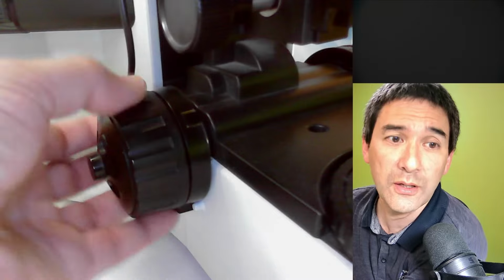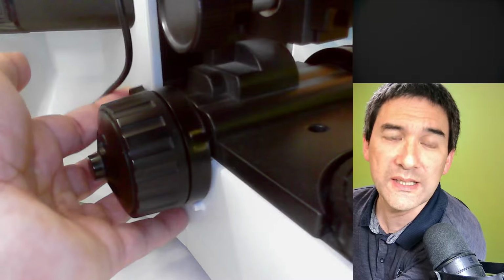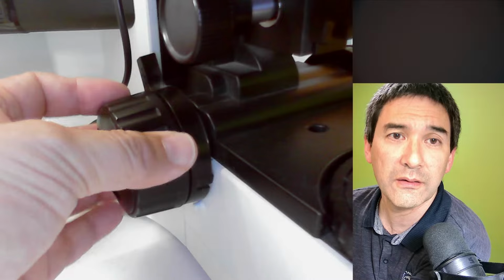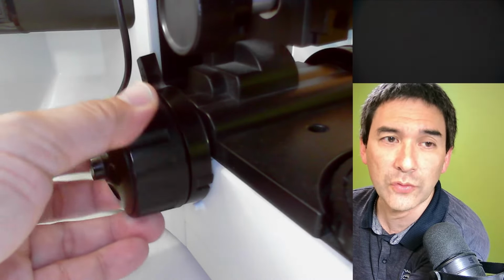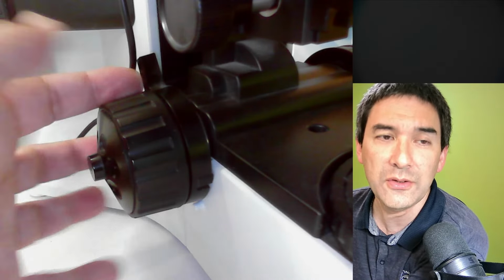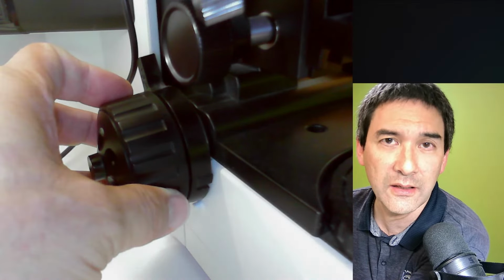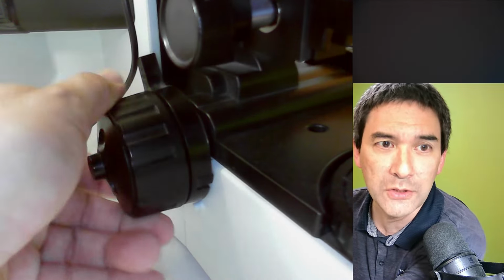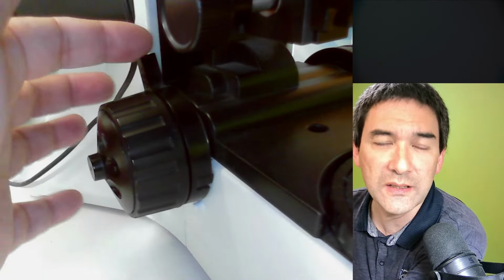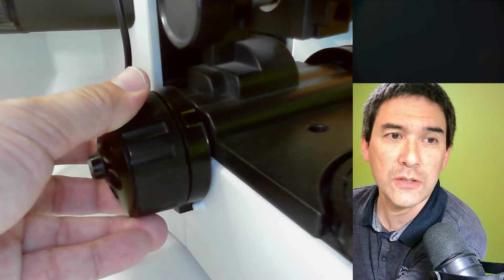It is next to the coarse focus knob, this lever over here. Basically what you do is set this lever up here, and when you're lowering the stage for defocusing and then rotating it again, it will not move higher than the setting over here. So when everything is focused, you can lower it, add the immersion oil, and then simply rotate it back here, and you'll be fine. It's a very convenient tool, but when you move the lever back, you're unlocking it, and then you can move it yet further.